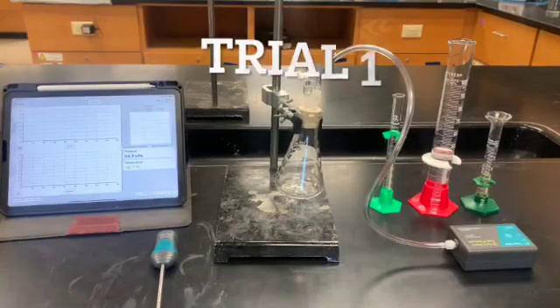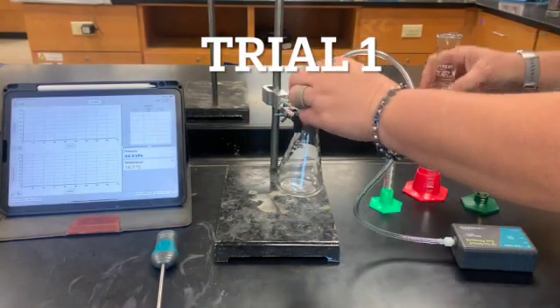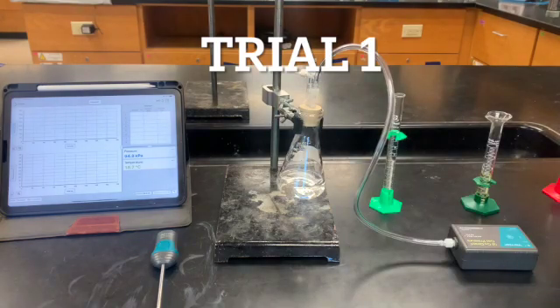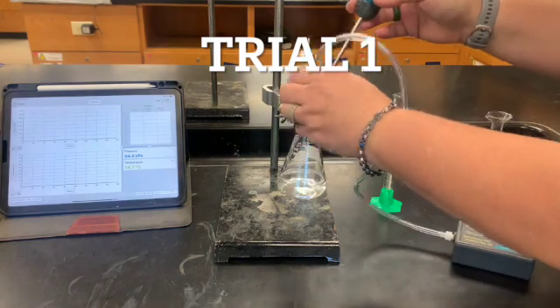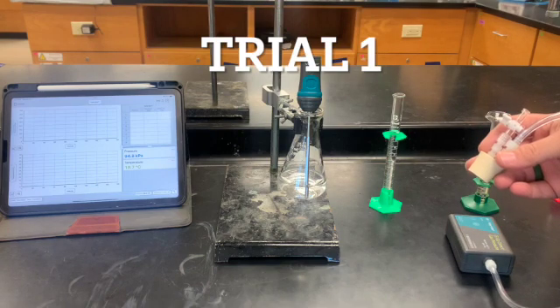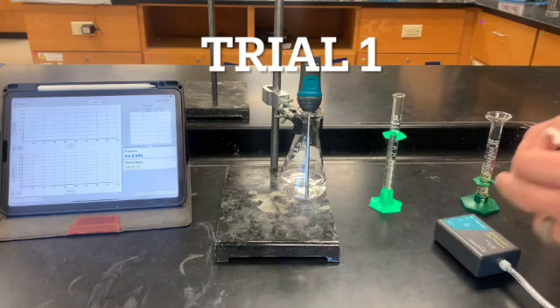All right, so first up, we're going to add the 45 milliliters of water to our flask. Okay, and it doesn't exactly tell you to, but you want to go ahead and get a starting temperature of that. And you're just going to have to physically record that as our starting temperature.